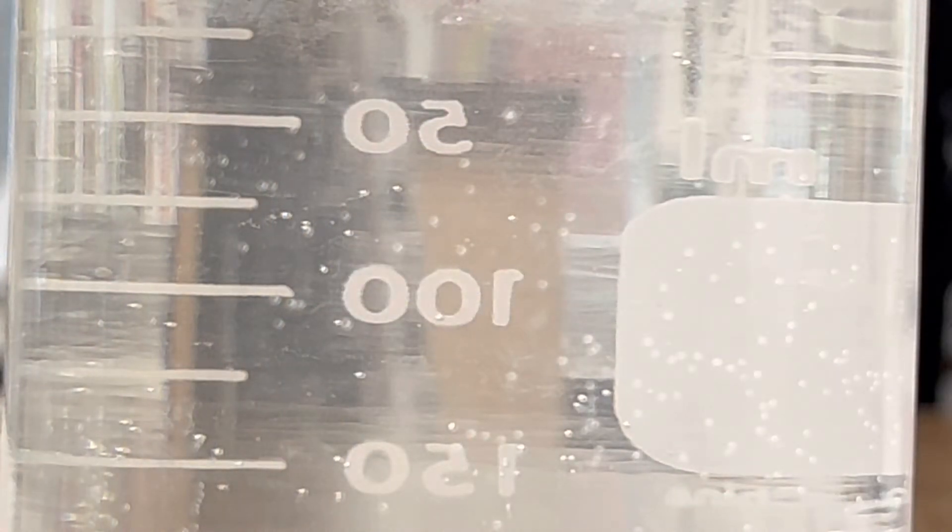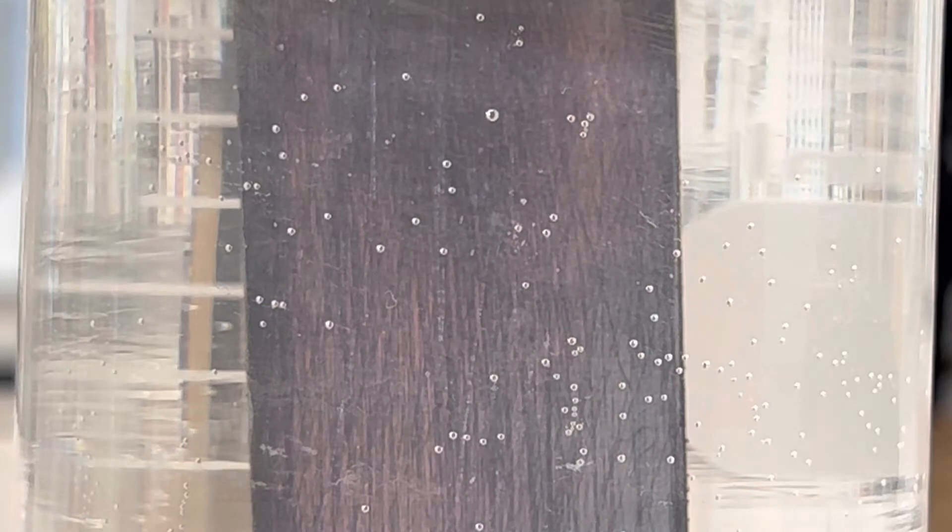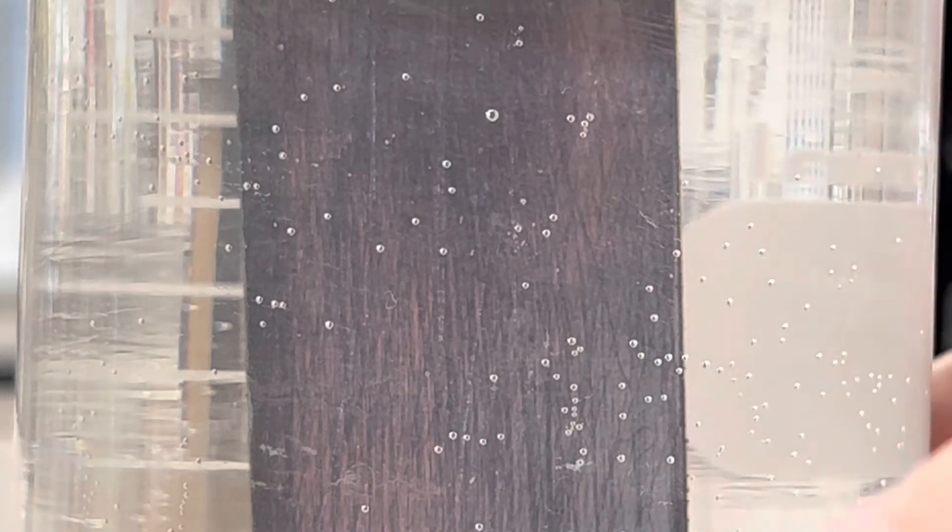The next step is to lower your strip of zinc into the solution. I'm putting this clip on the top to hold it in place, so you can really see the crystals grow.